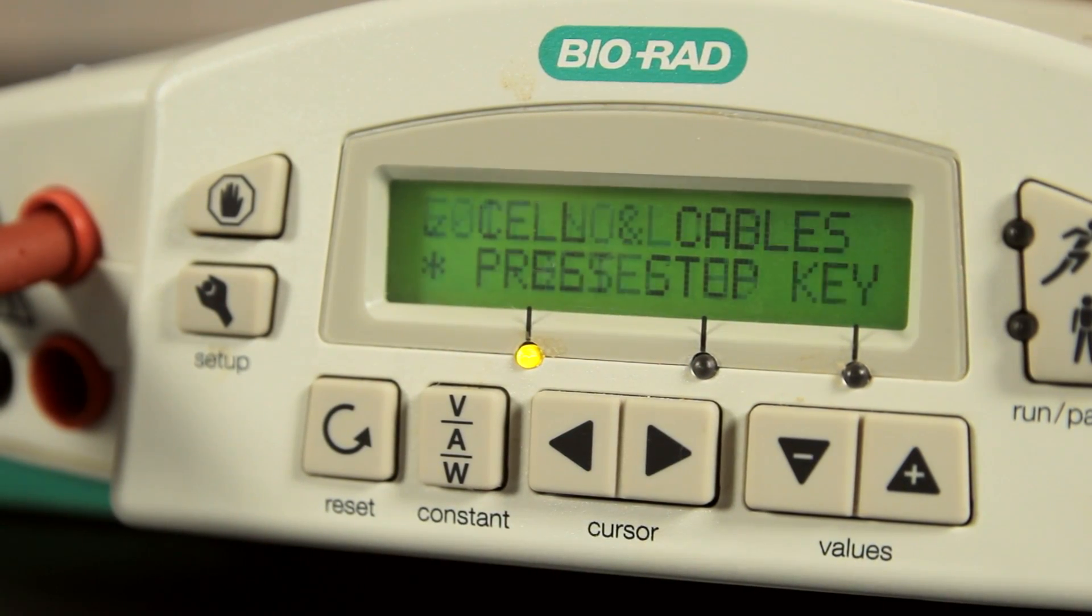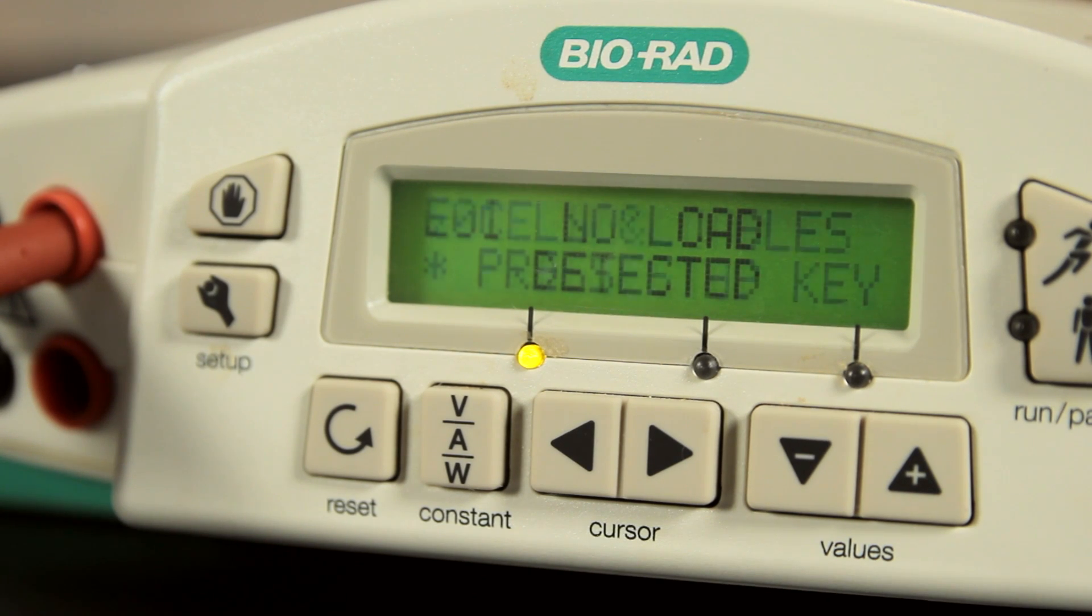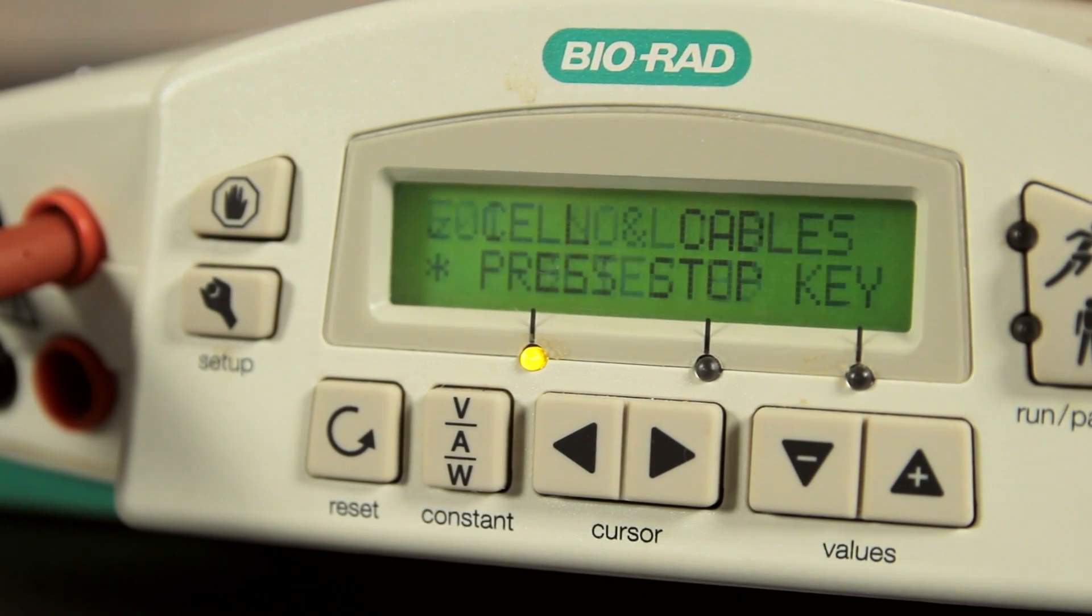When running a mini-protean gel with a BioRad power supply, you may experience an E1 no-load detected error message. This error usually means there's a break in the circuit somewhere, or that the current has dropped below the lower limit of the power supply. There are several possible causes for an E1 error, but they're all easy to remedy.